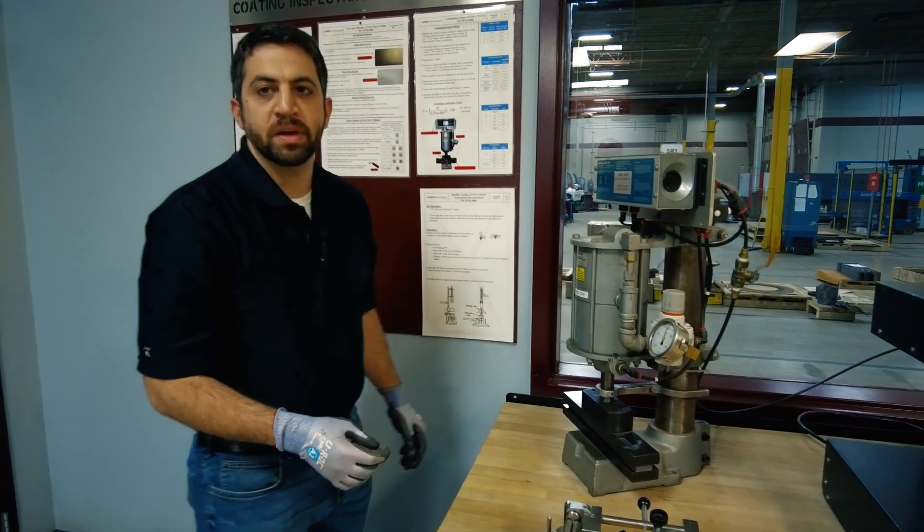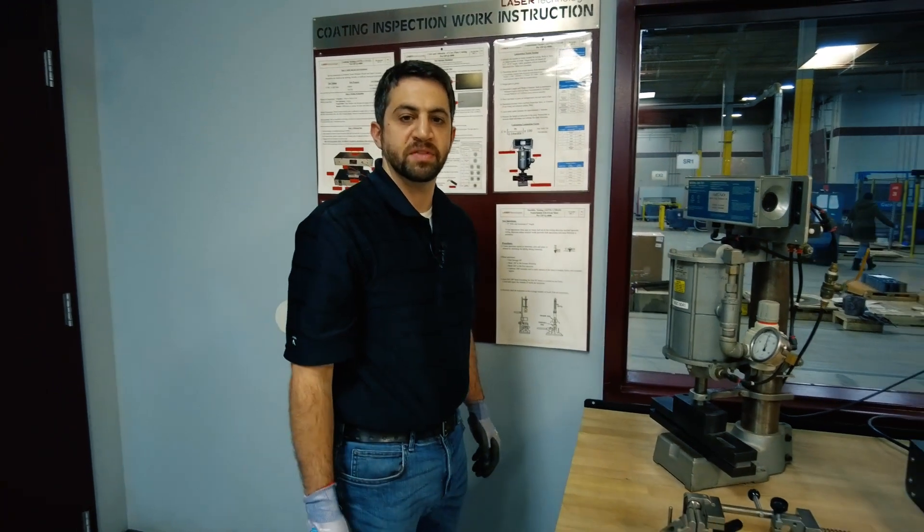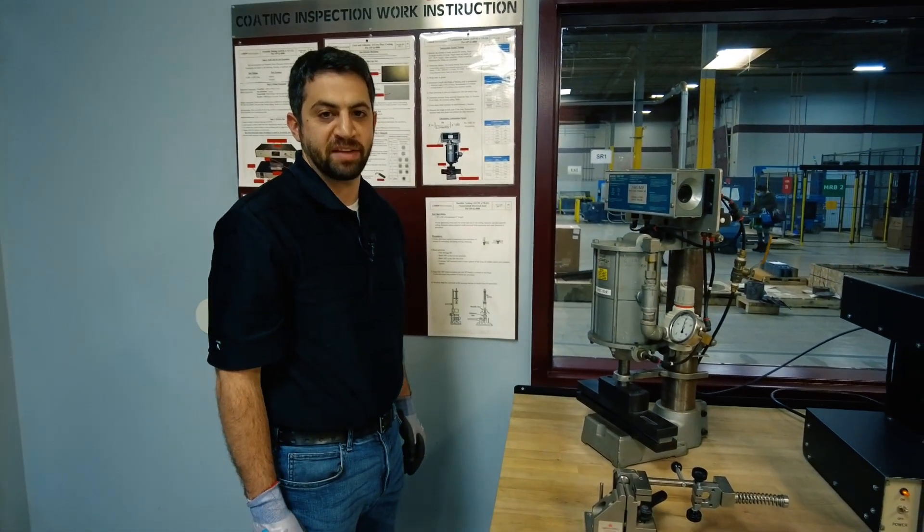This will allow us to determine how much of our stack is metal and how much of it will be the core plate coating and can give us a percentage of stacking factor.